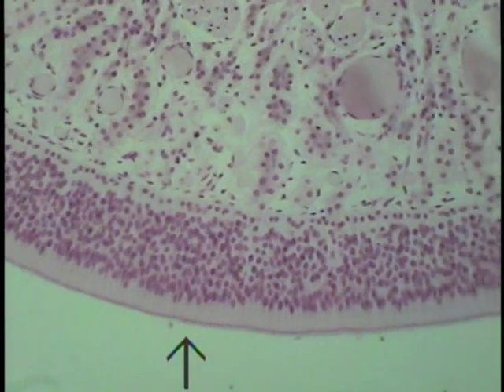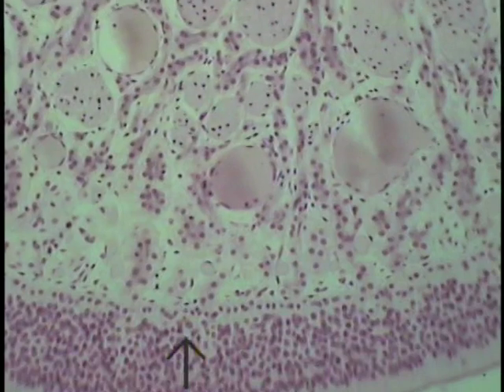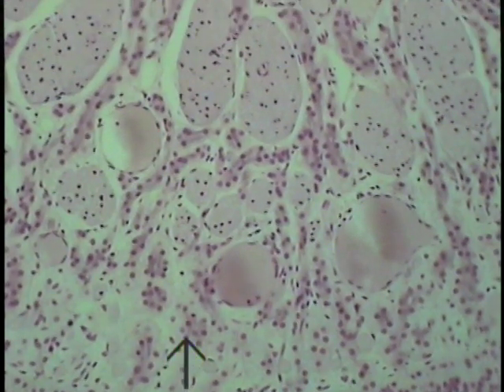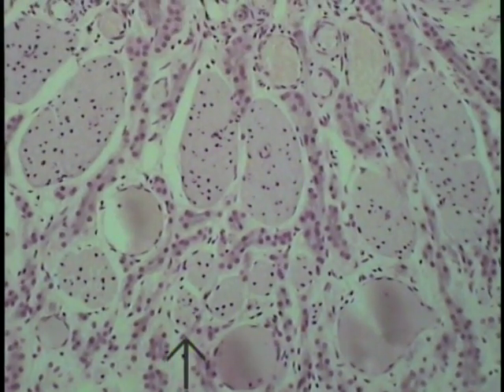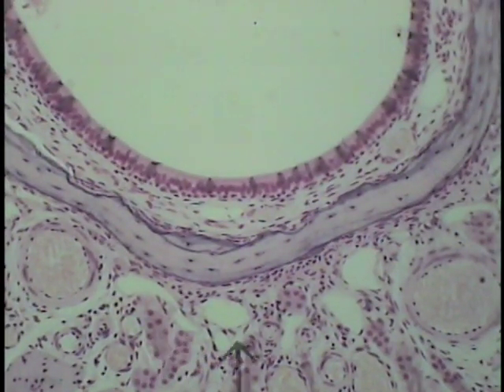So this is typical olfactory epithelium and its supporting structures within the underlying lamina propria. The lamina propria plus epithelium will be anchored and united to the conch bone as indicated by the arrow, as is the respiratory mucous membrane on the opposite side.